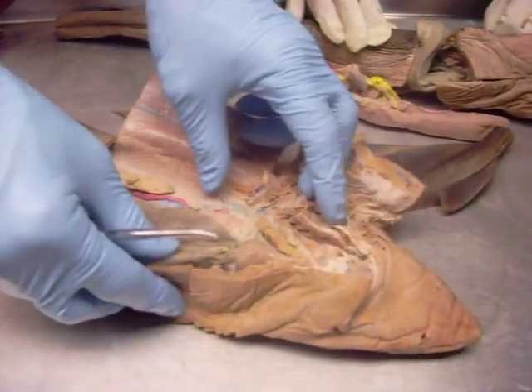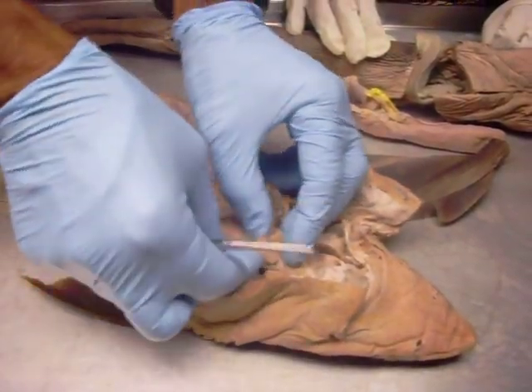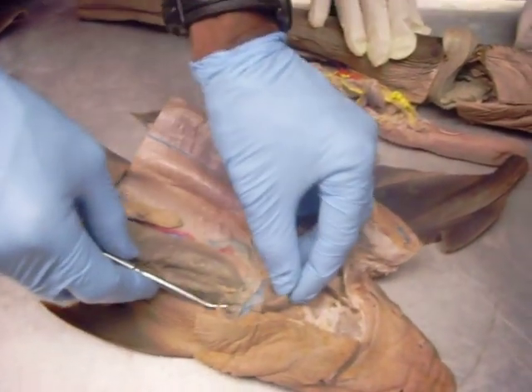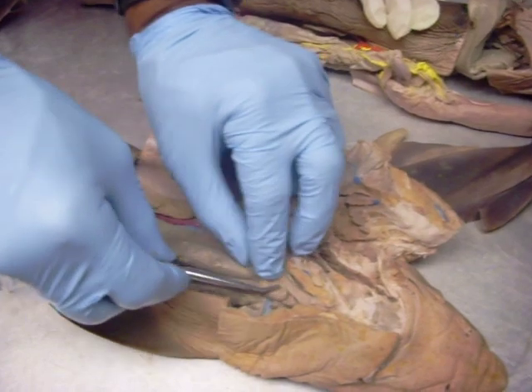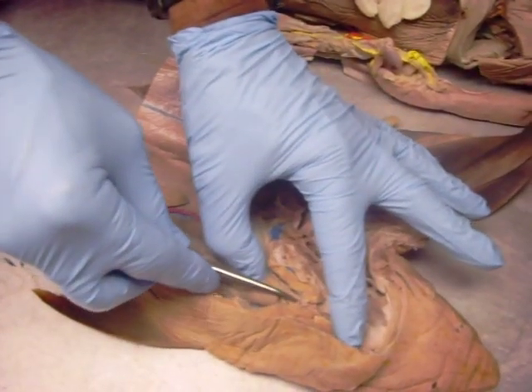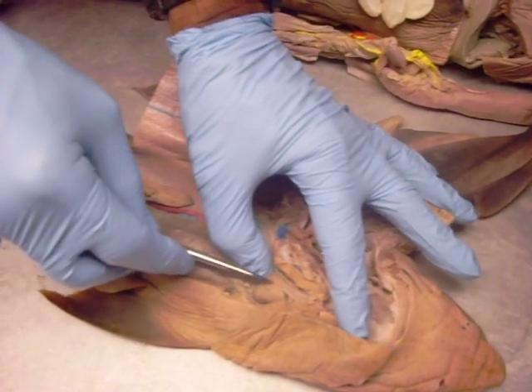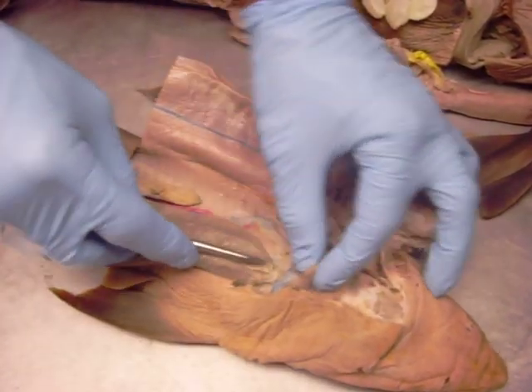Now let's do some circulatory. With the circulatory, if I pin out this thing, that's the ventricle, and this is the conus arteriosus right there. So ventricle here, conus arteriosus.